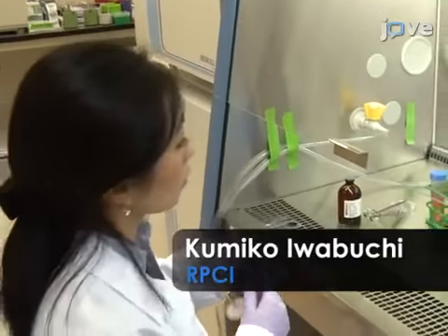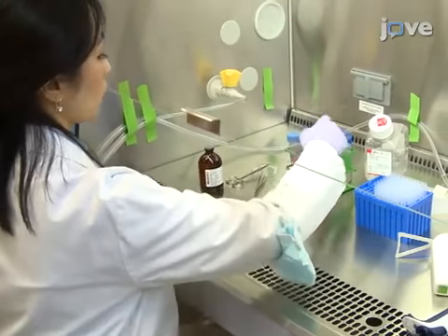Demonstrating the procedure will be Dr. Kumiko Iwabuchi, a postdoctoral fellow from my laboratory.